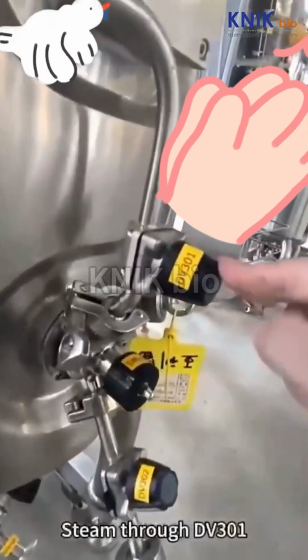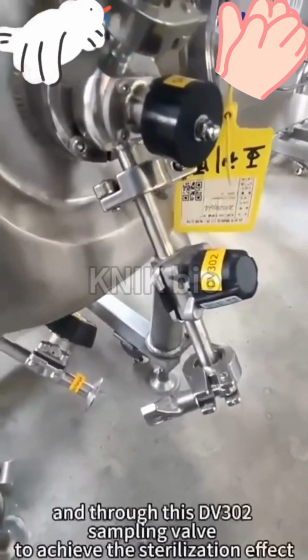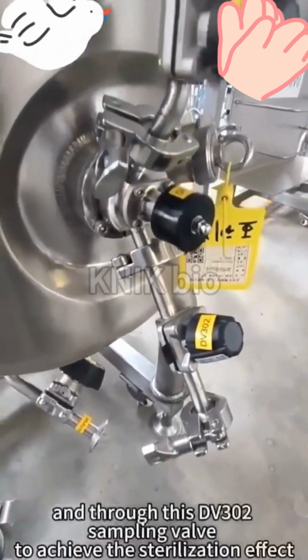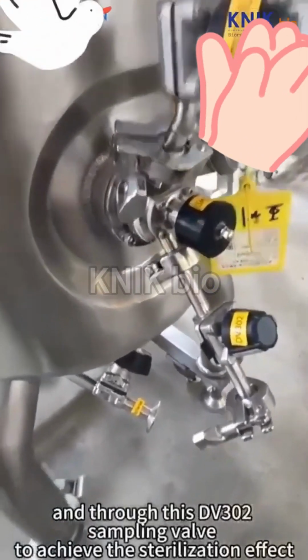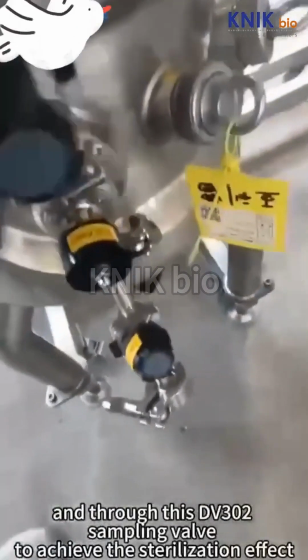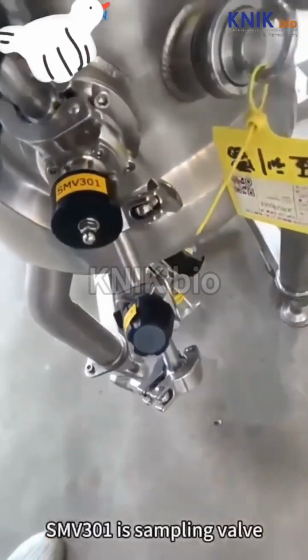Steam through DV301, and through this DV302 sample valve to achieve the sterilization effect. SMV301 is the sampling valve.